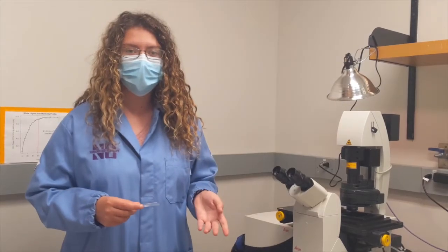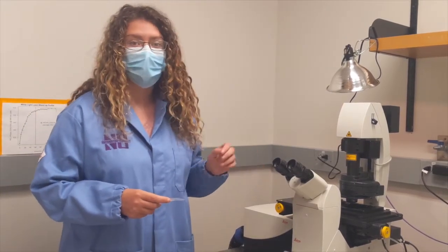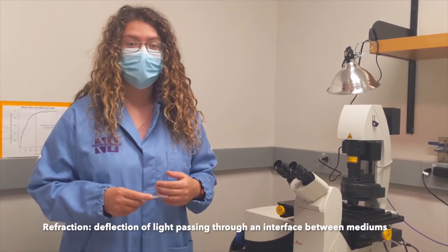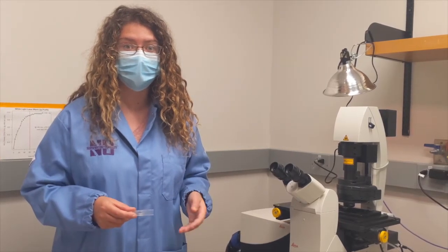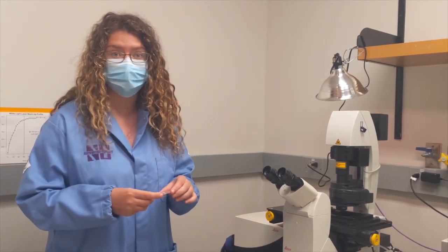To set up the microscope for imaging, I first place a drop of oil onto the microscope slide, and then a drop of oil onto the objective of the microscope. This oil prevents refraction of light and allows for more light to be picked up by the detectors of the microscope, creating a sharper image. I then place the microscope slide very carefully onto the microscope.